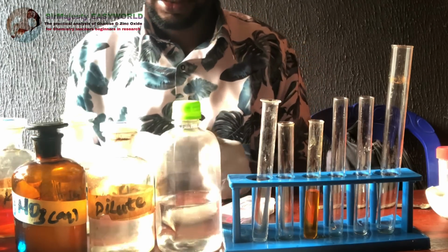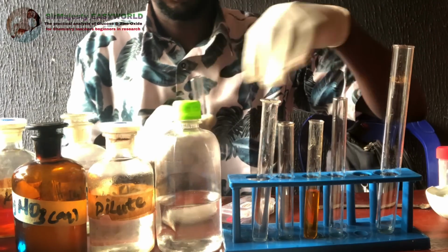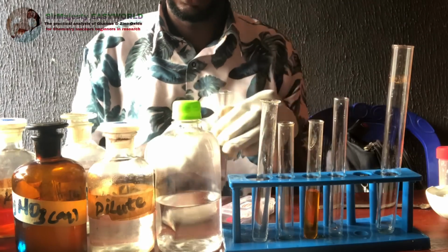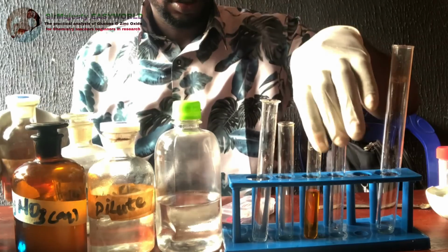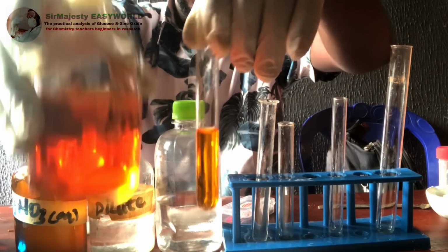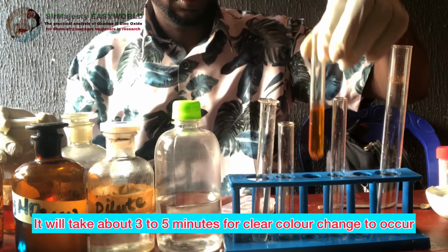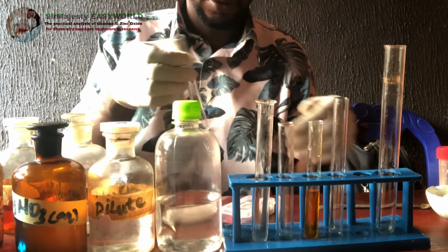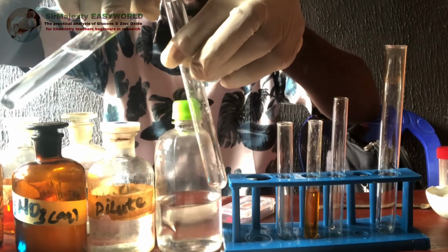So the next thing is to collect a second sample. You see the camera is there. With time, this will start turning gradually green, of course. So I added enough. If you compare the two, they are no more the same in intensity of their color. So another sample, if you have, you'll be told to collect another sample like this.